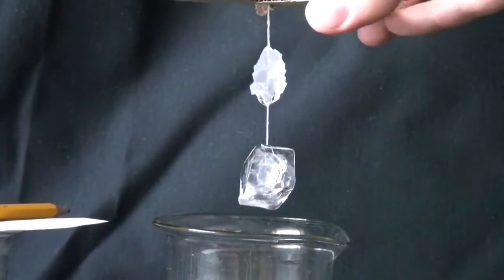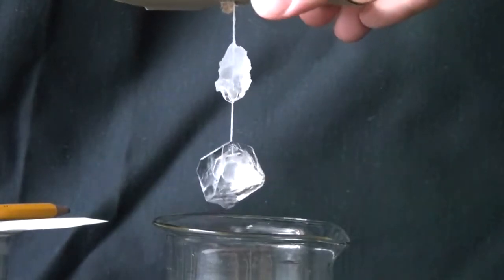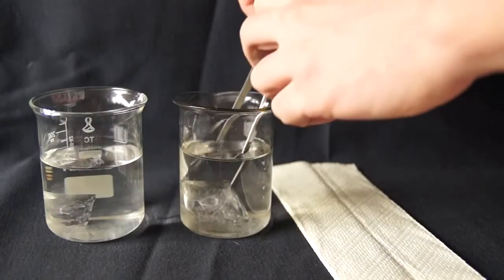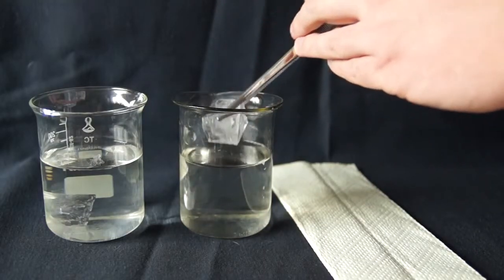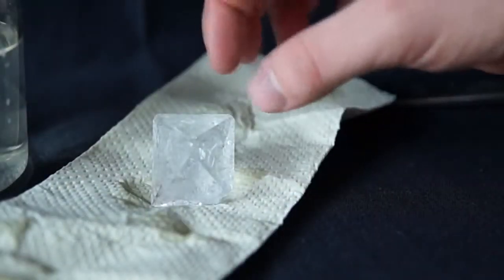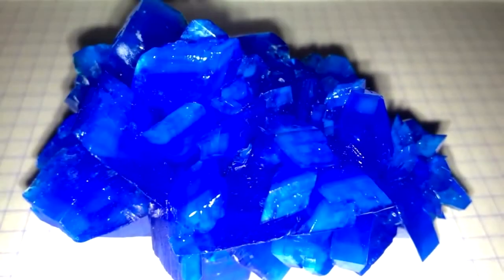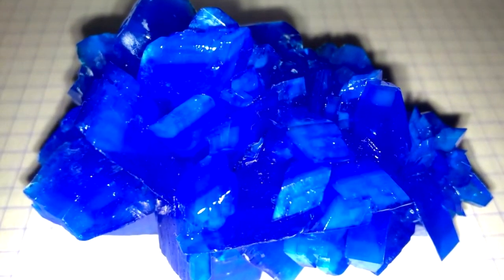Over time, my crystals of potassium alum became bigger. As you can see, they have acquired a very interesting form. And now, after about three months, I have grown two beautiful crystals of potassium alum. They are not perfect and not entirely smooth, but I still got the single crystal structure. For those who don't know, a single crystal is one large crystal, and a polycrystal is a set of crystals merged together during their growth.